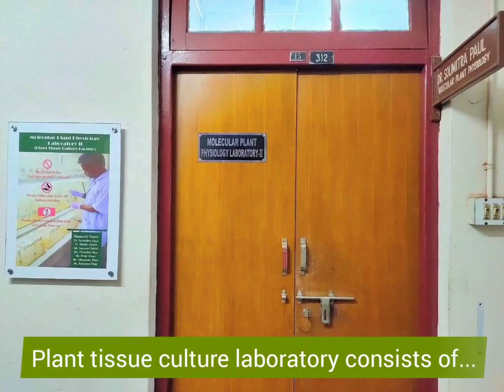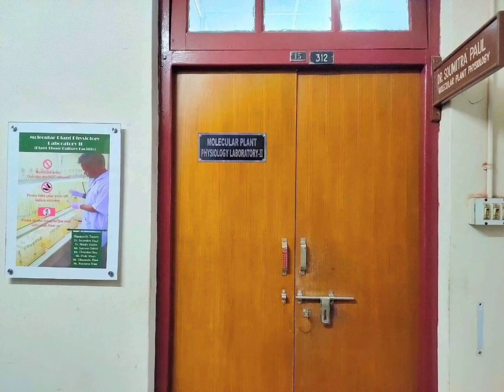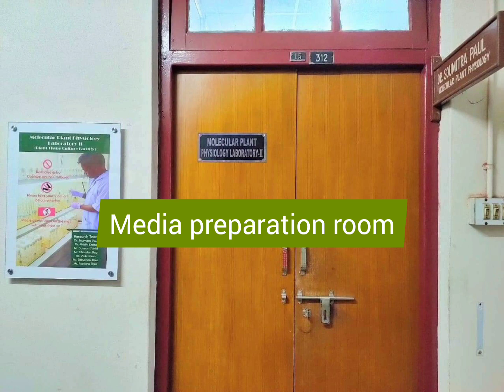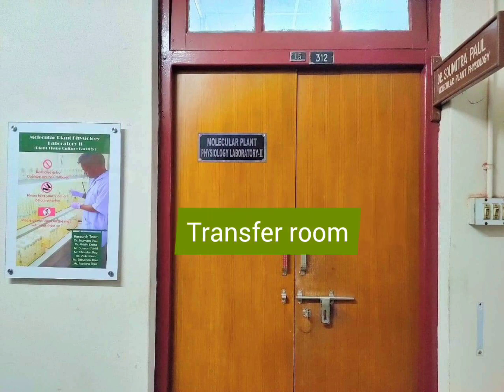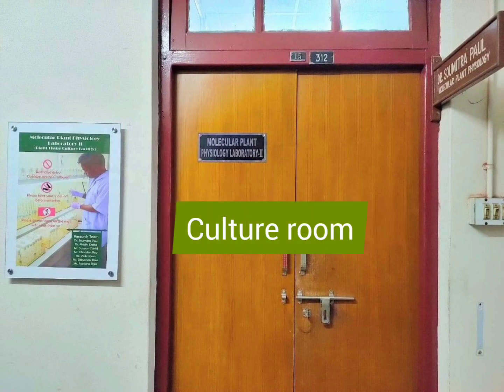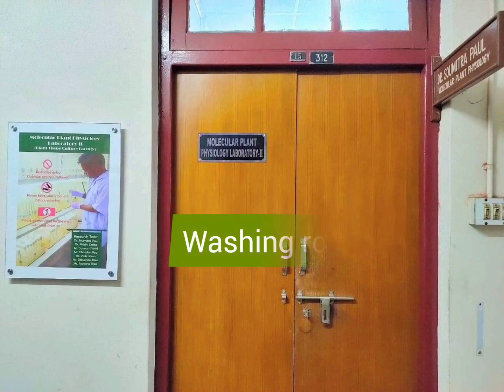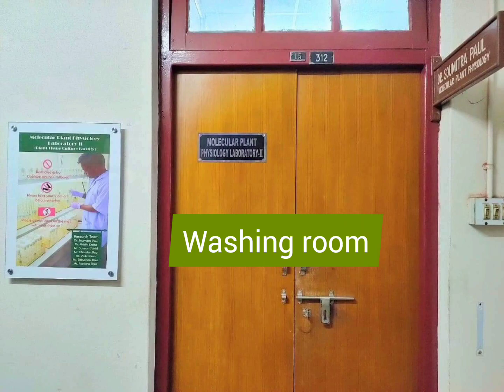A typical plant tissue culture laboratory consists of three main parts: a media preparation room, a transfer room, and a culture room. In addition, a separate washing room is required.